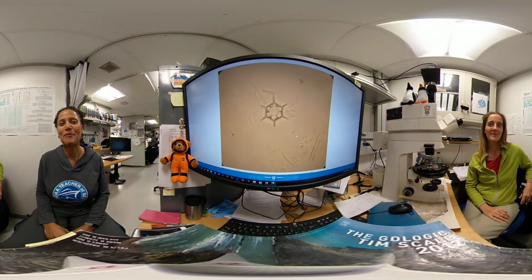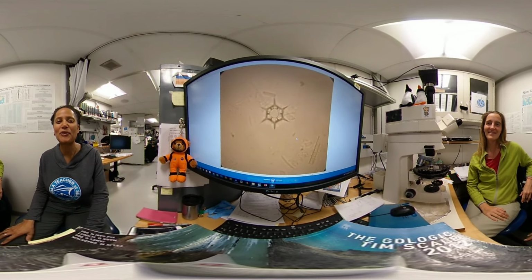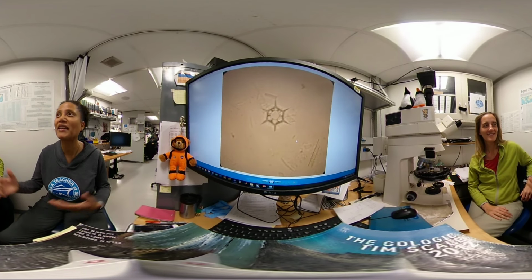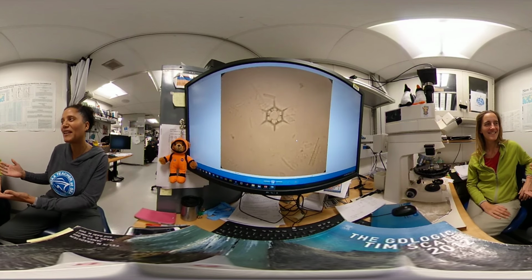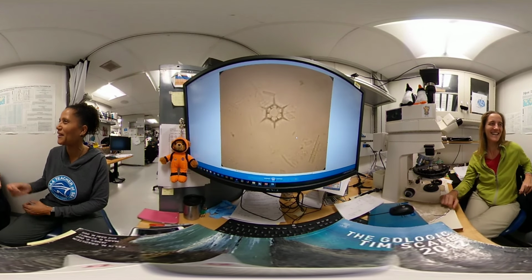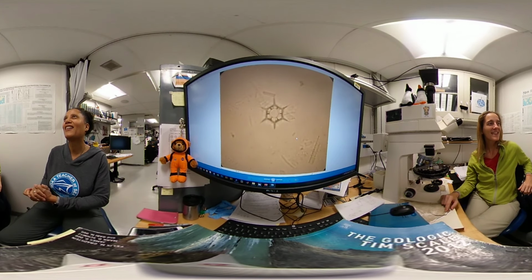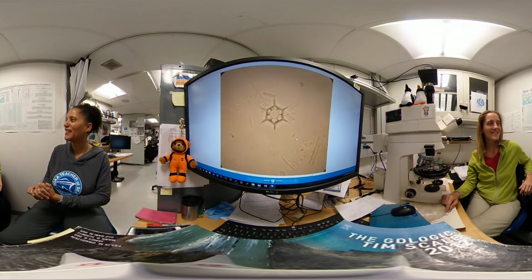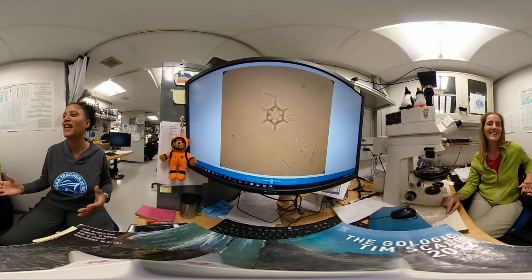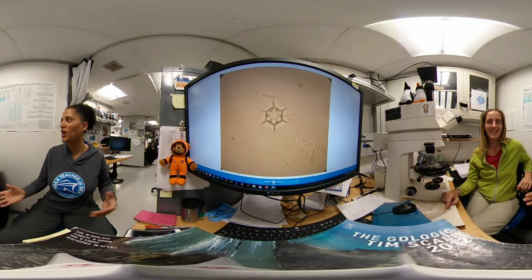Hello everyone, I'm Sian Proctor, the Science Communication Outreach Officer on the JOIDES Resolution Expedition 383, and I'm in the Micropaleontology lab with Micropaleontologist Elisa Malinverno from Italy. I'm trying to think of saying hello in Italian. Ciao. Ciao tutti. So what is it that you look at while here on the JR?